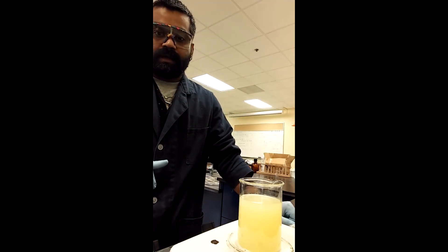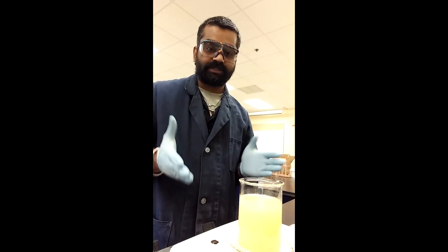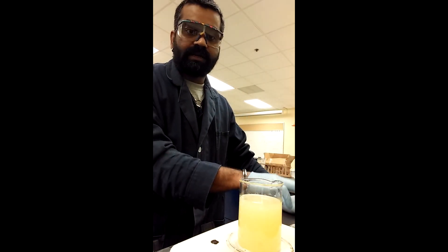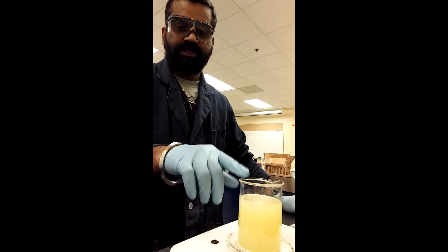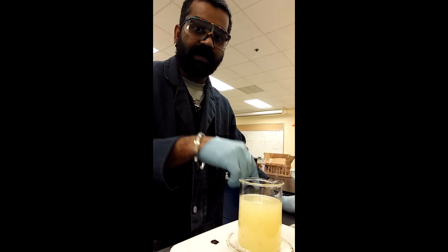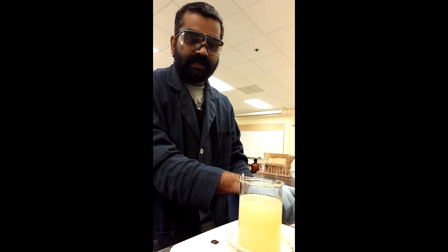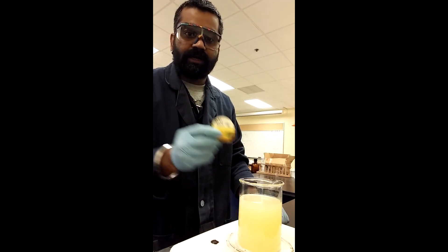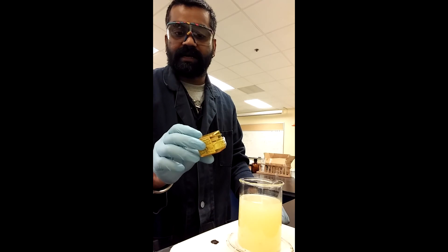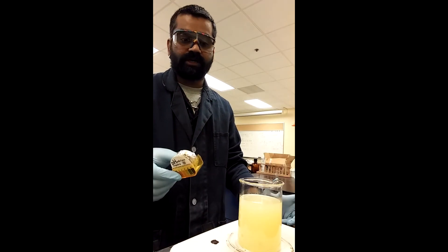I'm going to stir and as I stir I'm going to add sodium hydroxide. If you remember your titration of weak acid versus strong base — which is essentially what we're doing — citric acid is the weak acid and sodium hydroxide is the strong base. You need three equivalents of hydroxide for one citric acid molecule, because citric acid contains three protons. Each proton needs a sodium hydroxide. So what we're trying to do is add sodium hydroxide with constant stirring and periodically check the pH with our pH paper. We're looking for a green color — a darker green, which is about pH 9. If you see a darker green solution when you test your pH, that's when you stop adding sodium hydroxide.